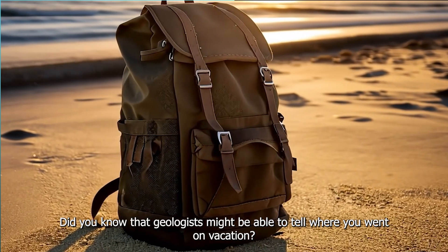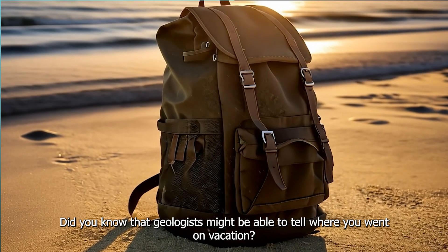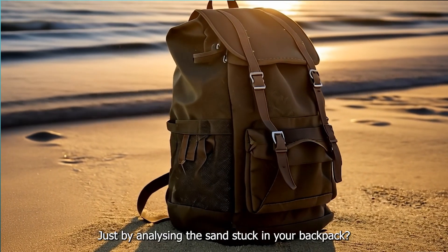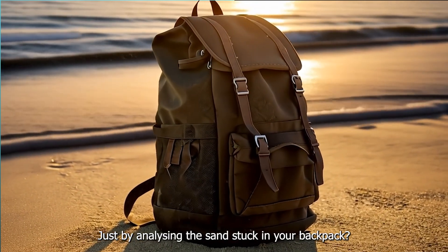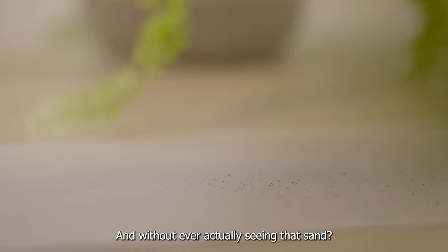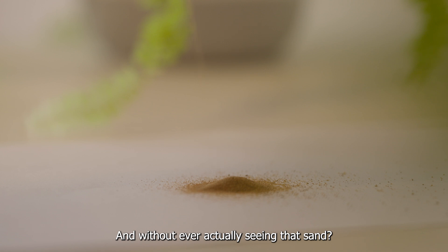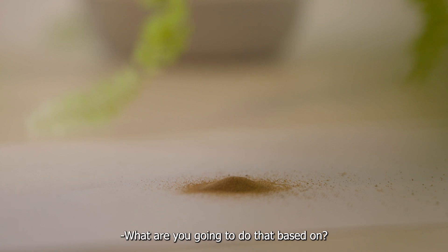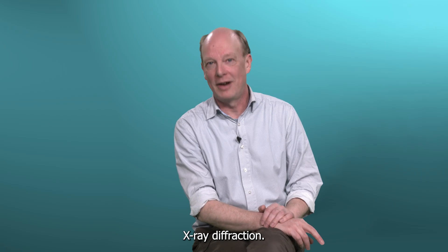Did you know that geologists might be able to tell where you went on vacation just by analyzing the sand stuck in your backpack? And without ever actually seeing that sand? What are you going to do that based on? X-ray diffraction.